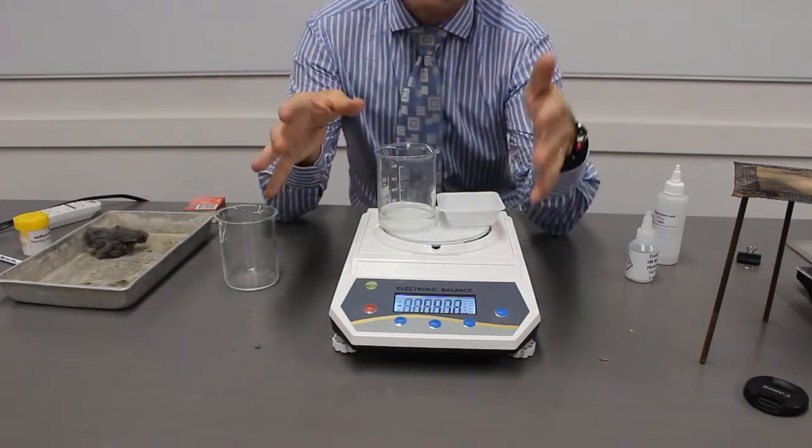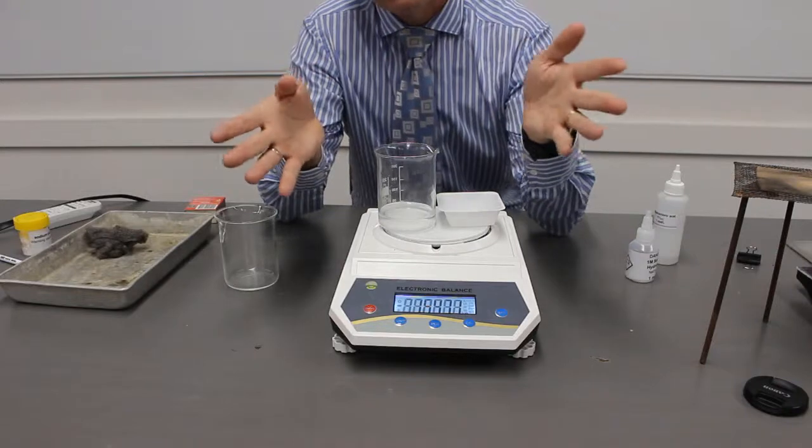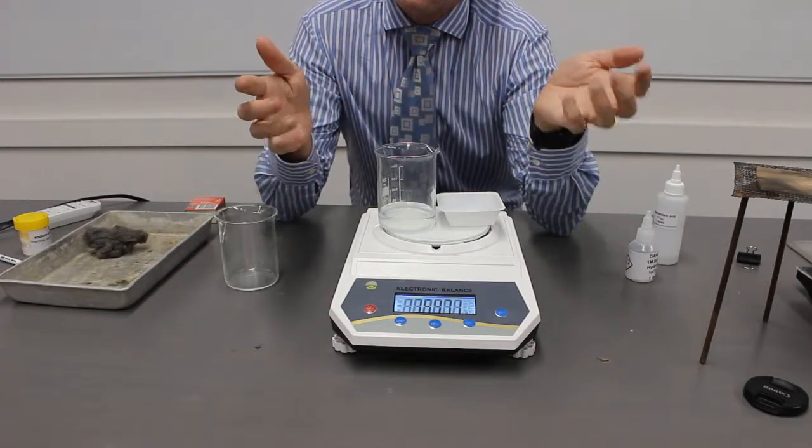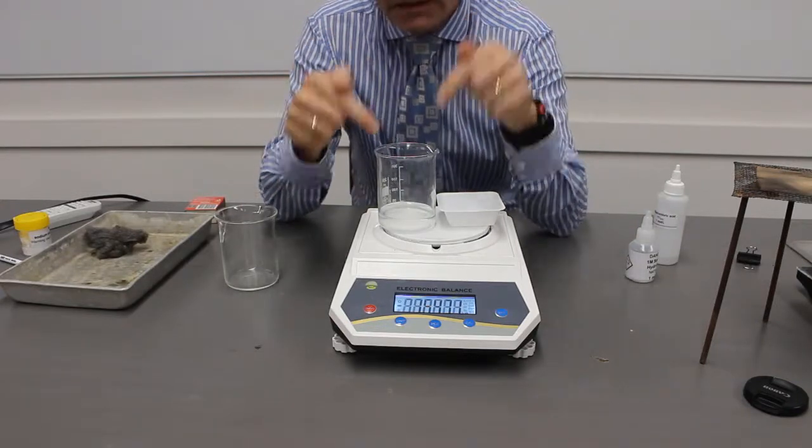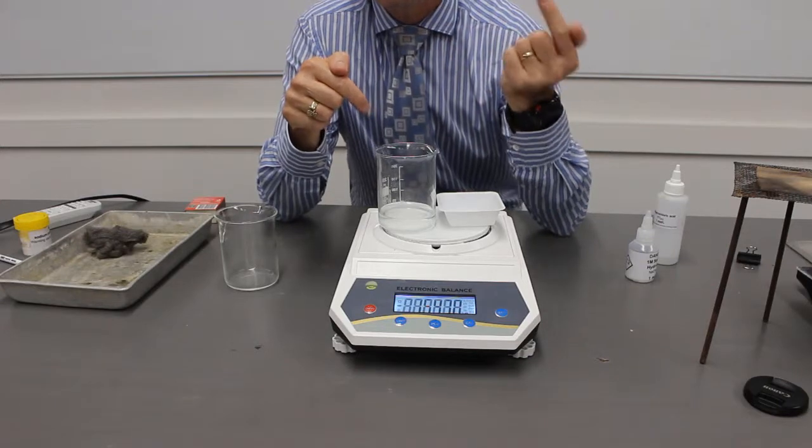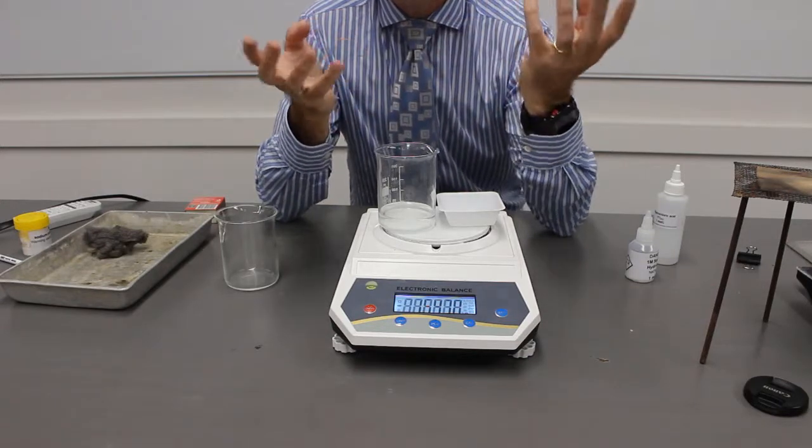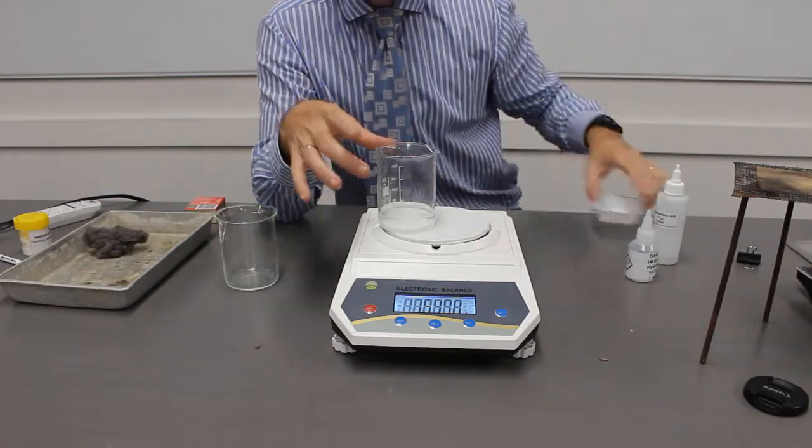So does that mean that this breaks the law of conservation of mass? No. Because we can explain where that mass has gone. Yes, it's decreased, but we know where it's gone to. It's gone into gas. I'm going to show you one more experiment.